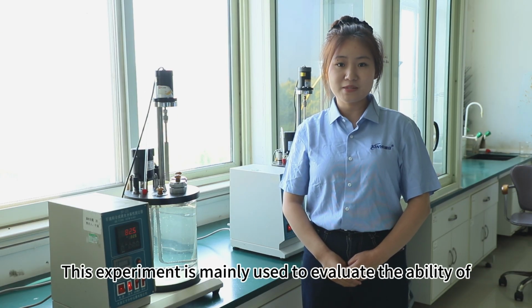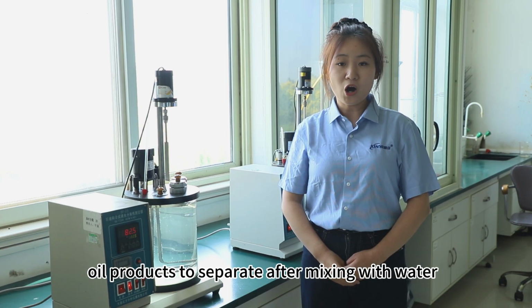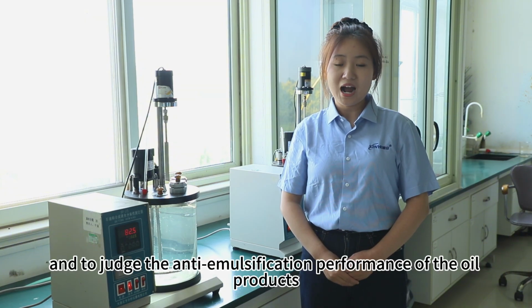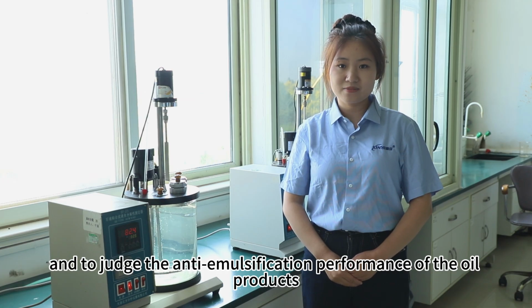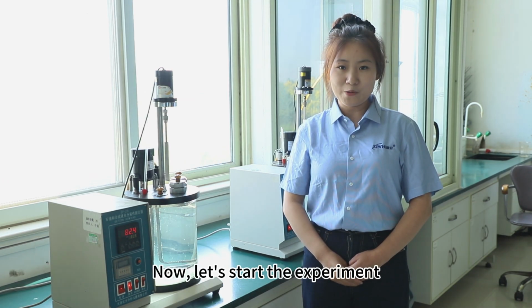Today I'd like to talk about the experiment for determining the water separability of petroleum and synthetic fluids. This experiment is mainly used to evaluate the ability of oil products to separate after mixing with water, and to judge the anti-emulsification of oil products. Now let's start the experiment.